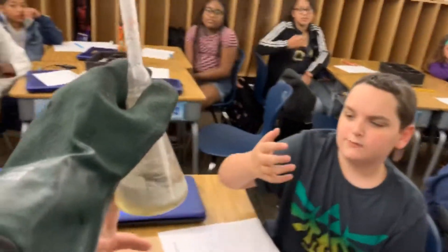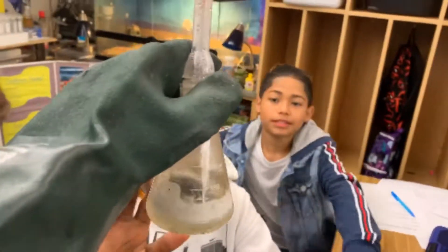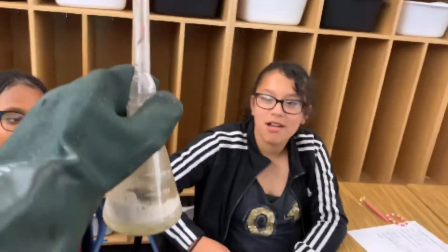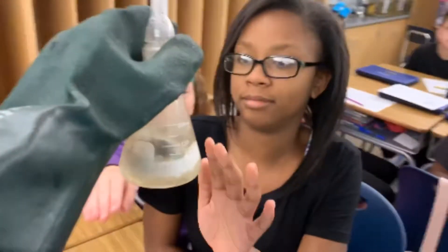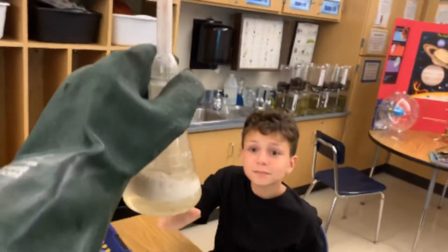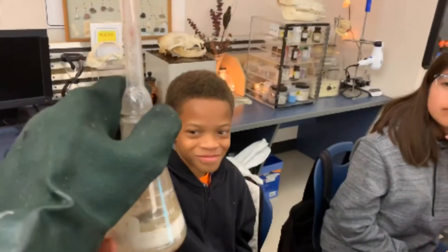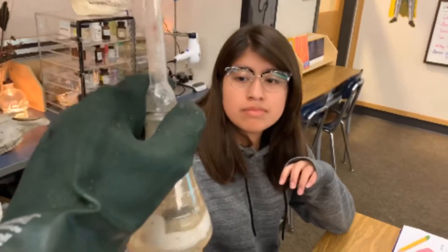I'm feeling heat with my gloves on — it's getting warm. Look at my balloon, it's inflating — exothermic! Do you feel any heat? It's getting hotter. What's happening to the aluminum foil — is it getting smaller? It's hot, isn't it? Here's my balloon, it's inflating. I feel warm to the touch — exothermic.